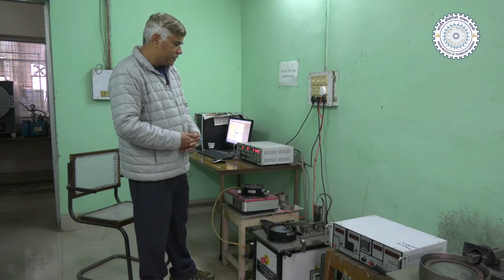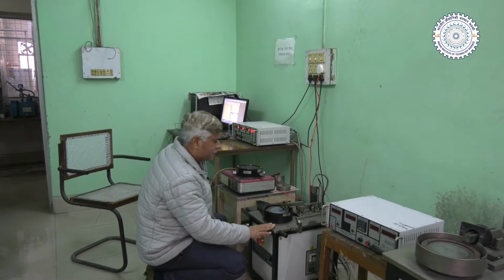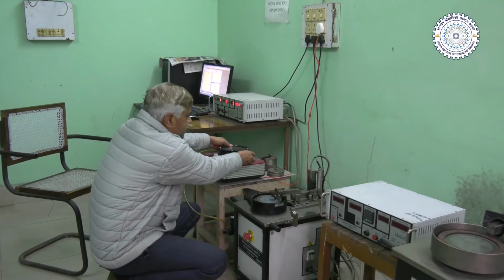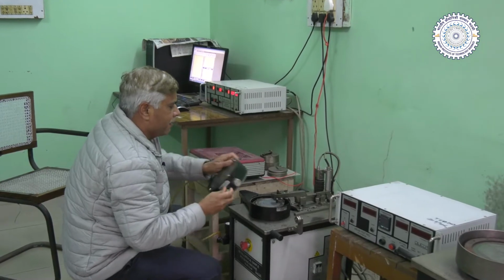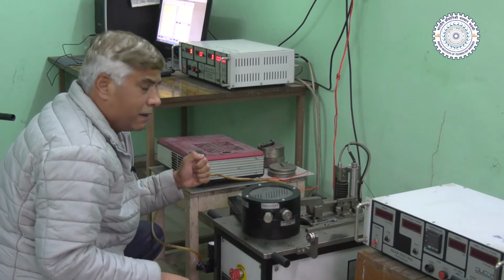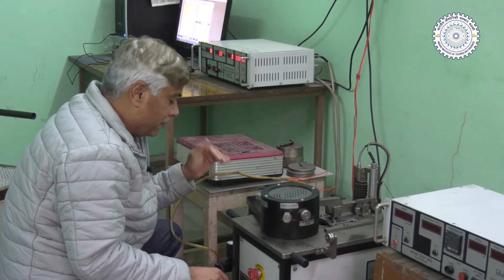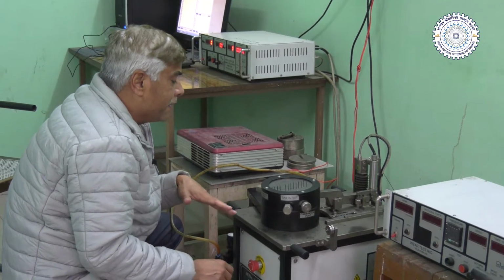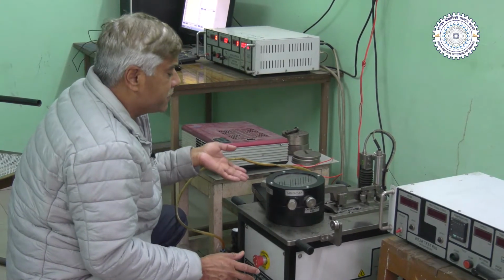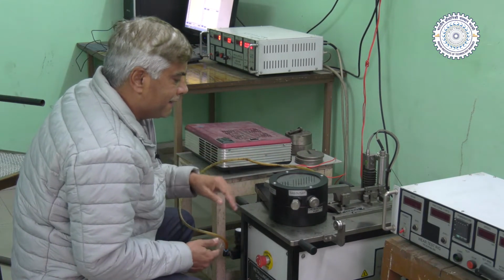I believe this system has a maximum wear depth measurement of 2 mm, that is 2000 micrometers. If we are interested in conducting the adhesive wear test in a controlled environment, then what we can do is, this is just a cover, so we can make it a closed chamber and supply a suitable environmental gas, which may be oxygen, carbon dioxide, hydrogen, or nitrogen. Or we can feed the lubricant also, if we want to see the friction and wear behavior of a given material against the given counter surface.